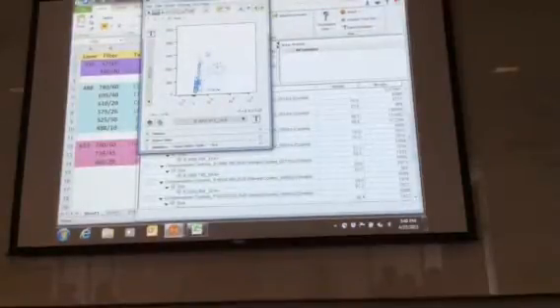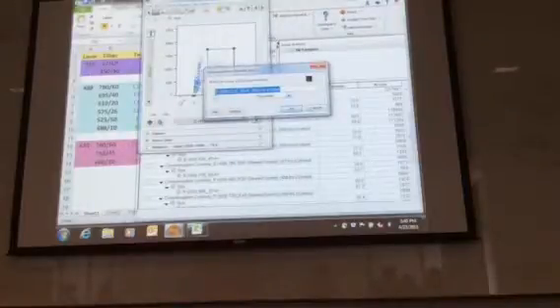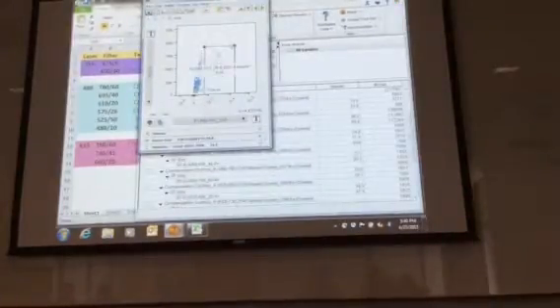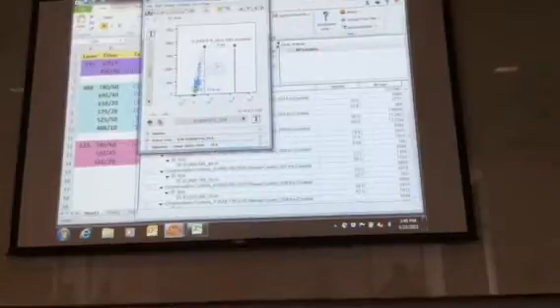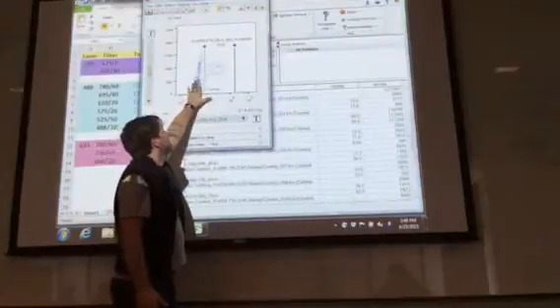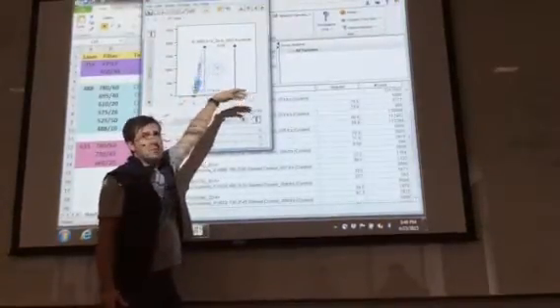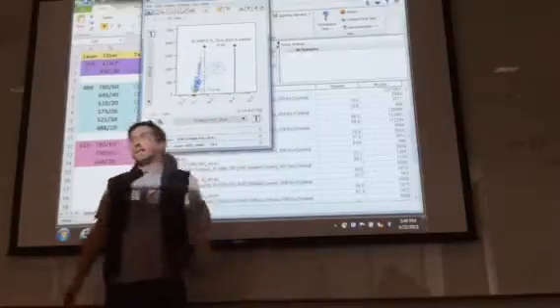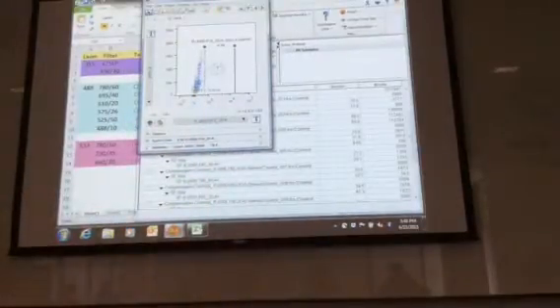But you could potentially say that, okay, you'd maybe want to use a different shaped gate, but you could say, okay, this is where you would actually draw the gate. Right here, anything that's in that box is positive. So this is where your cutoff is, this is negative. So you could use both the unstained, where you would only have a population of cells down here, and with the single stains, you then start to see what is positive. Now this is looking at all mononuclear cells, but it gives you an idea of where to draw the actual gate.